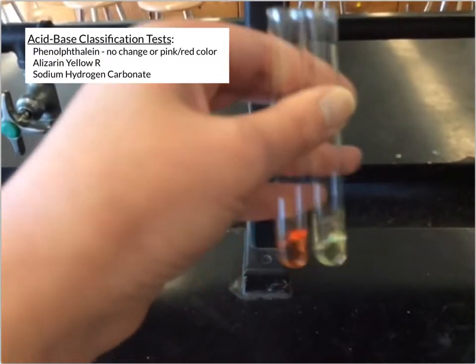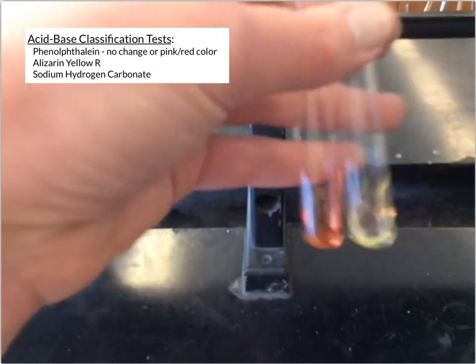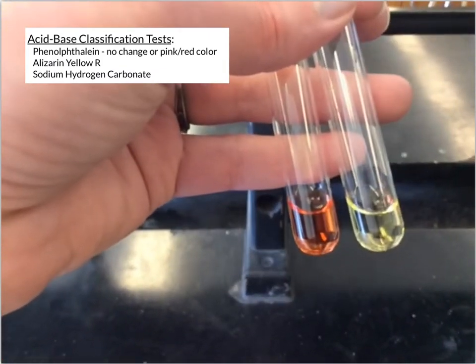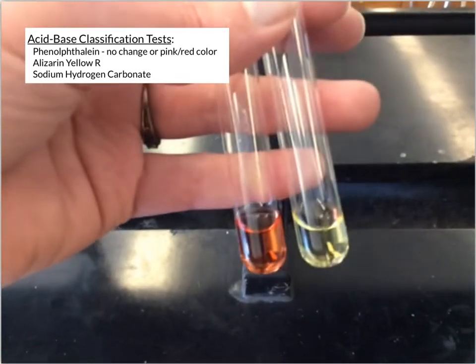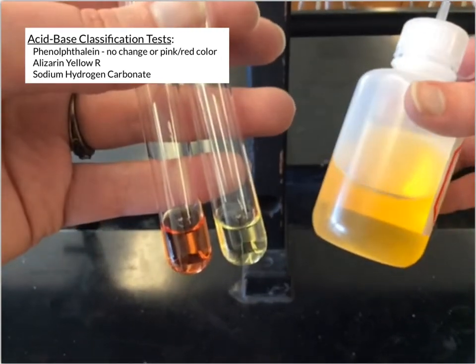And then kind of shake that a little bit. Now these both started out as clear solutions, and what you can see is the one on the left is kind of a reddish orange, and the one on the right is yellow. Now the yellow, of course, comes from that indicator, which starts out yellow. It's a little bit lighter because it's diluted.